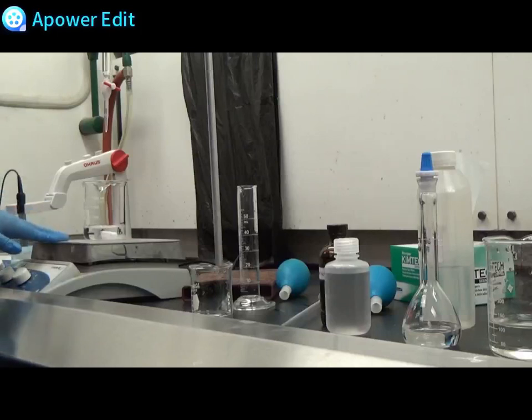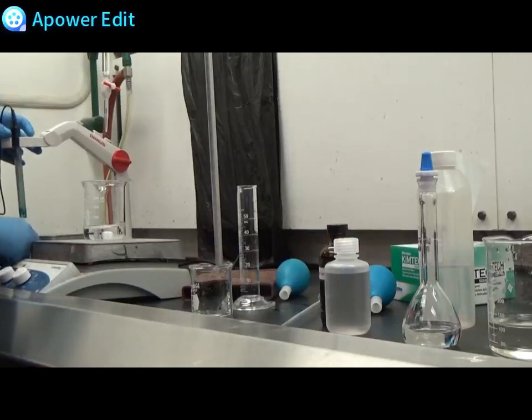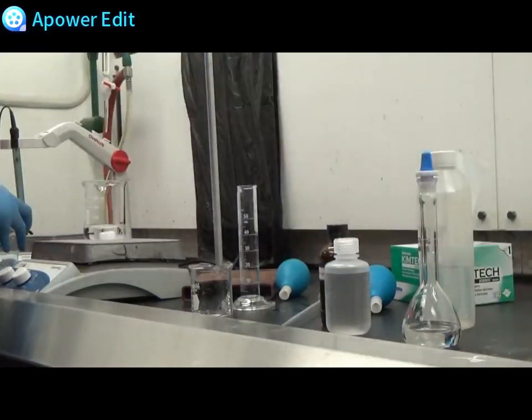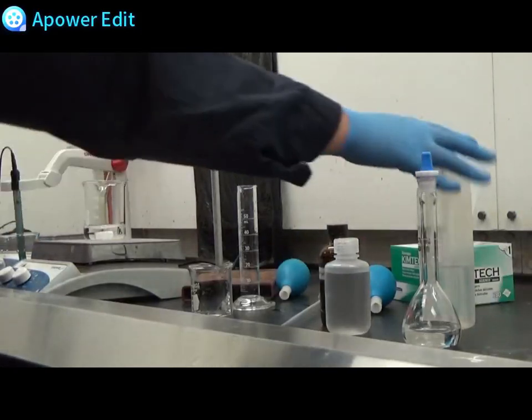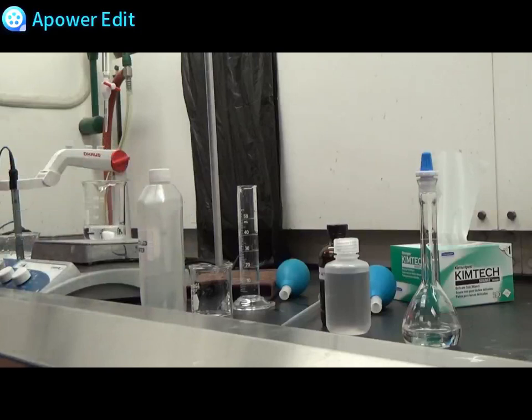I have 25 ml of water distilled and 25 ml of my 0.5 molar glycine solution. Now I can set up my pH meter to read the current pH. I want to read the current pH because I will be adding 6 molar hydrochloric acid to the glycine in order to drop the pH to about 1.5, and this is to be able to capture the two inflection points when we do a titration.